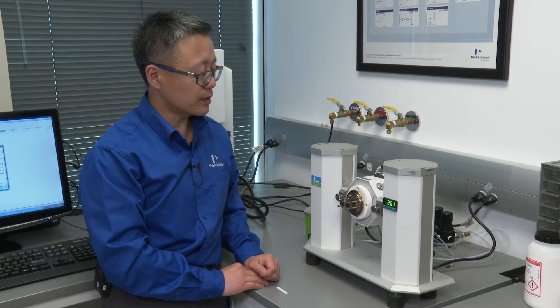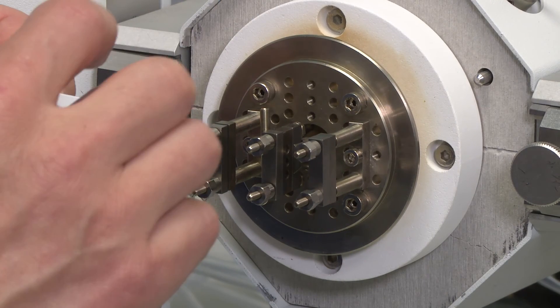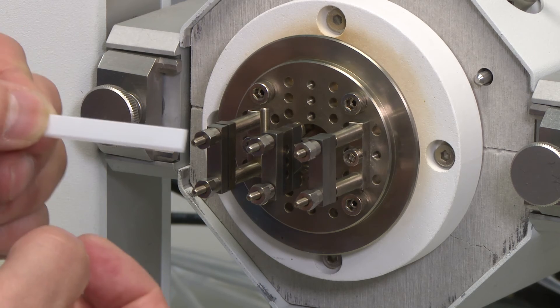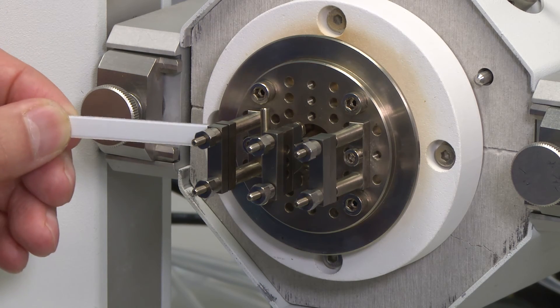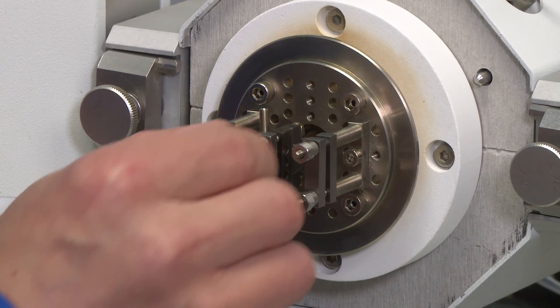After the calibration, you need to measure the sample width and thickness first, before putting the sample between the clamps.